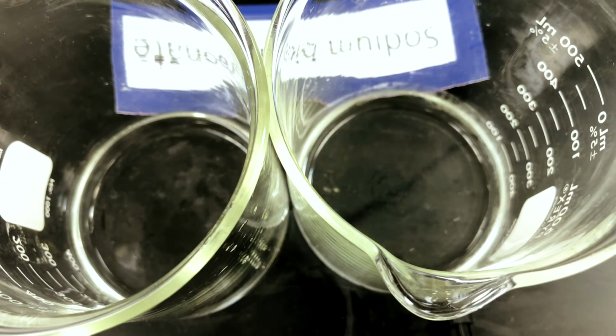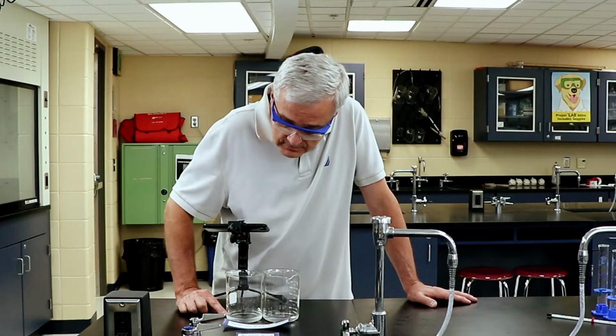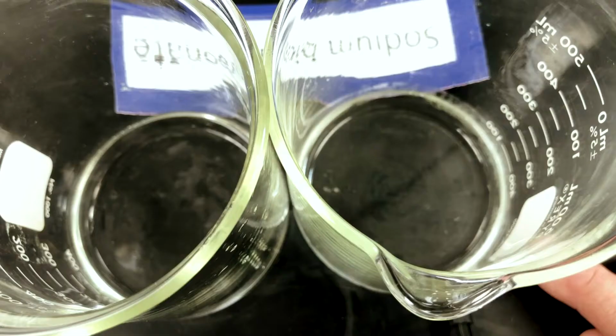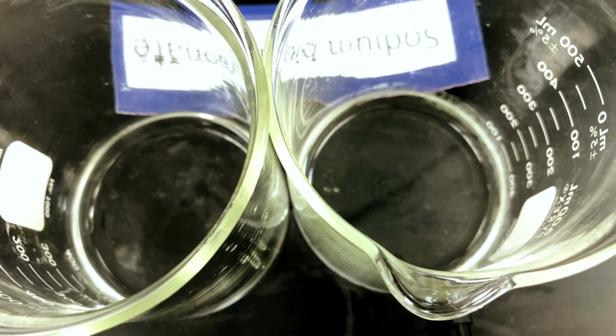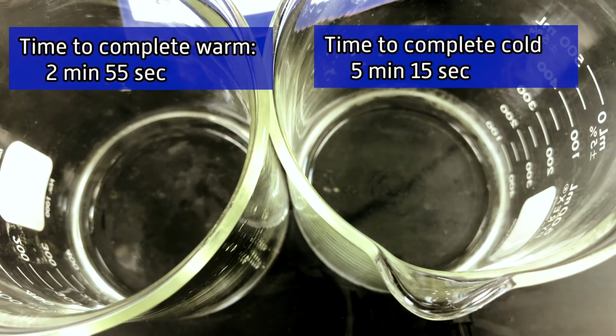Let's say there's one tiny little streamer of bubbles, and we are at 5 minutes. I'm going to watch that as it comes to an end. All right, so the reaction has ended in both of the containers, and we're going to call this complete.